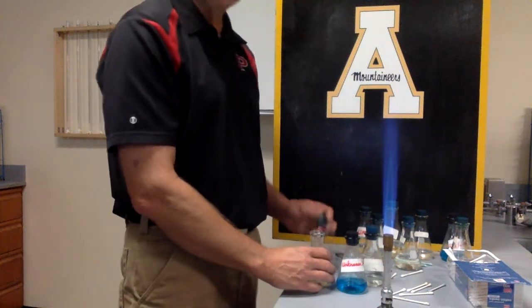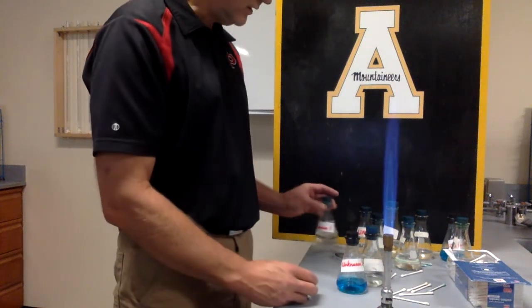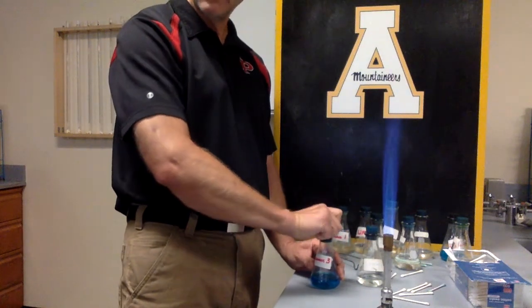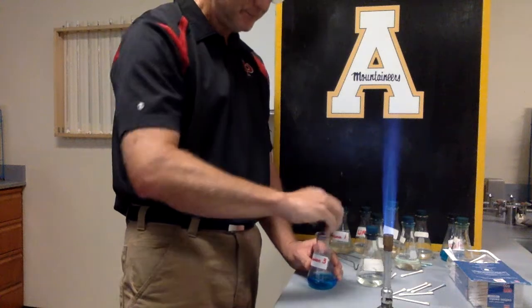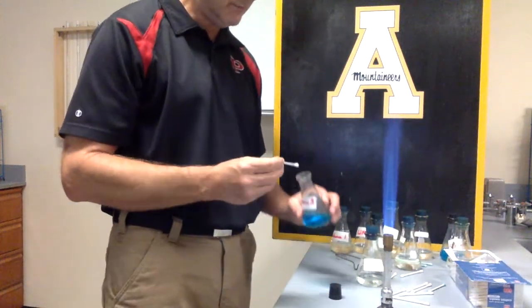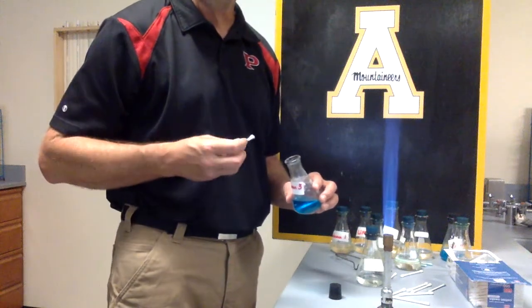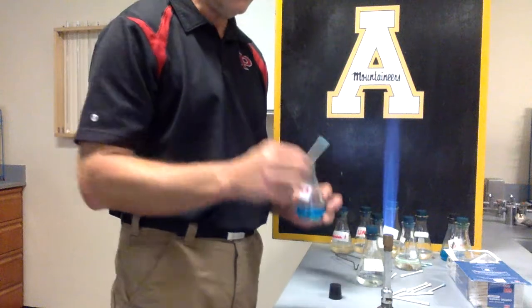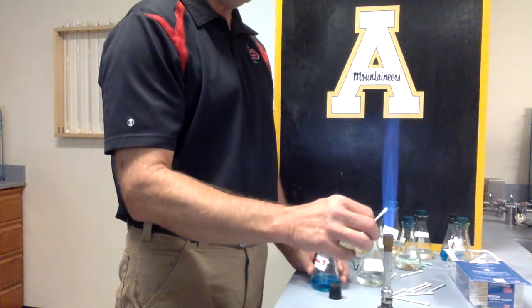So we would have to go back in and make sure that we're doing our notes so that we could determine the different shades of them if we had to. So what unknown do you think that is? This is going to be on page 32 of your digital notebook. We have 3 unknowns. Now I'm going to do this one.